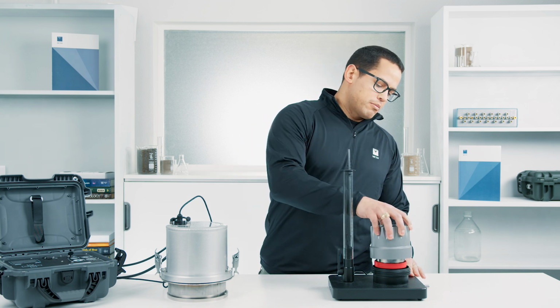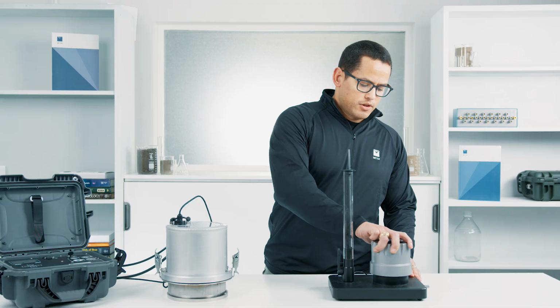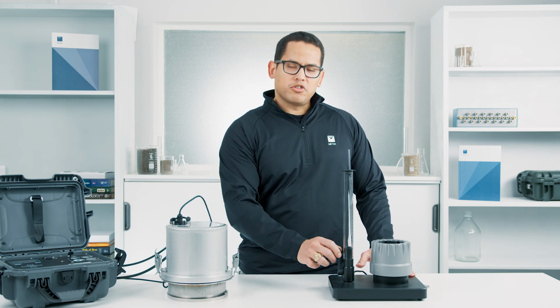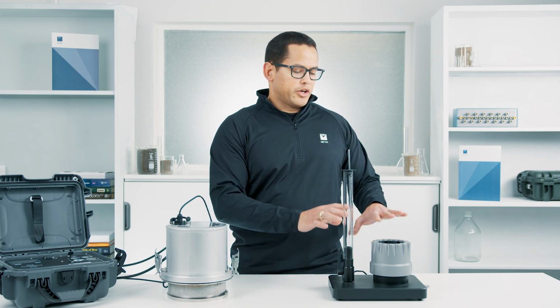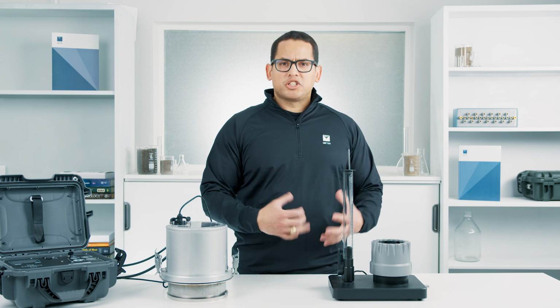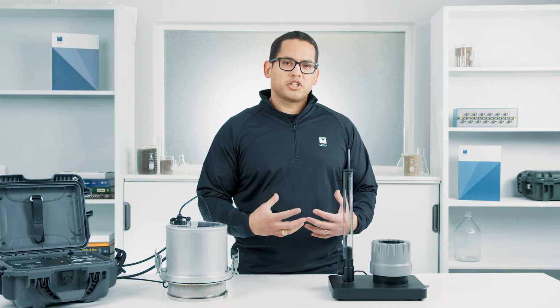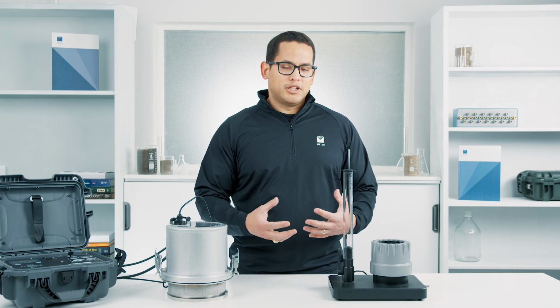And we're going to put this collar back on the sample. And that seals everything up. That way we have no leakage. And you're just going to fill this up with water, turn this knob, and then the device starts taking measurements. And this is going to be connected to your computer where the software is actually doing all of the measurements there. With this instrument, measurements typically take anywhere from a few minutes up to a couple hours, depending on the soil type and how fast the water actually flows through the soil. And you can run through many samples in a day pretty easily.